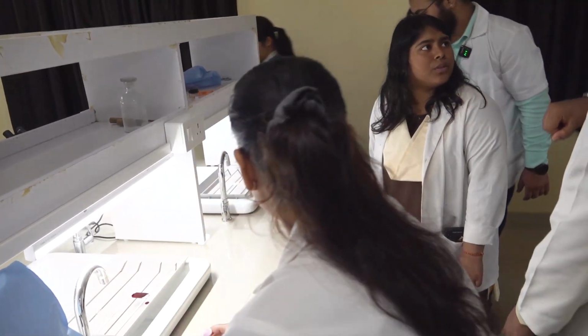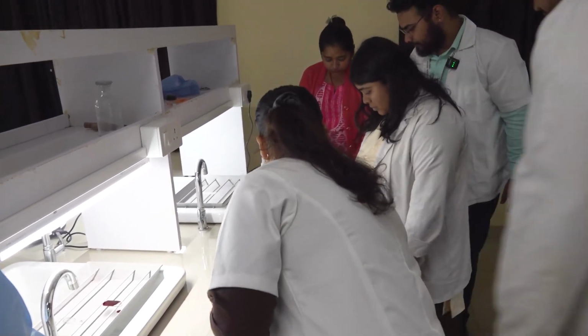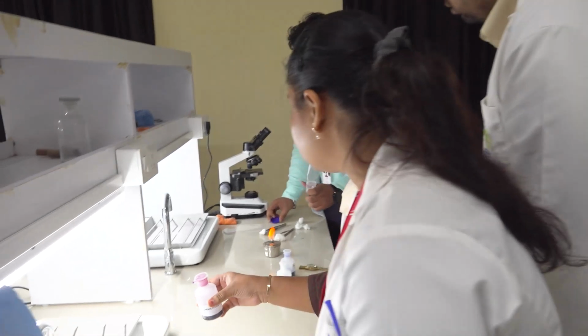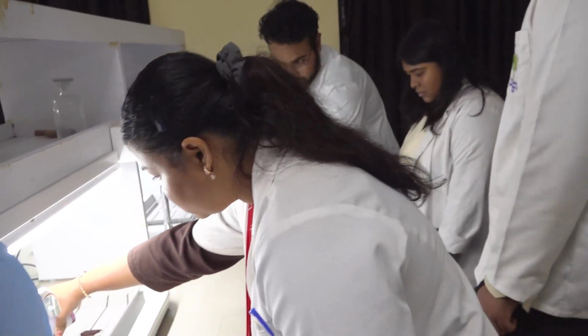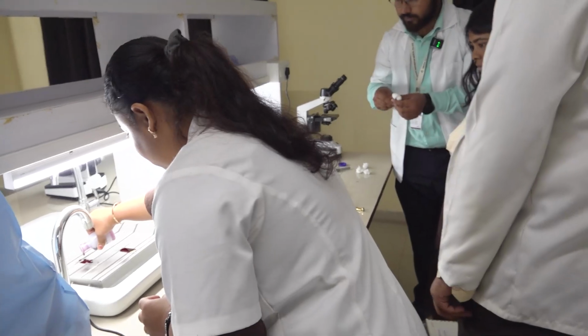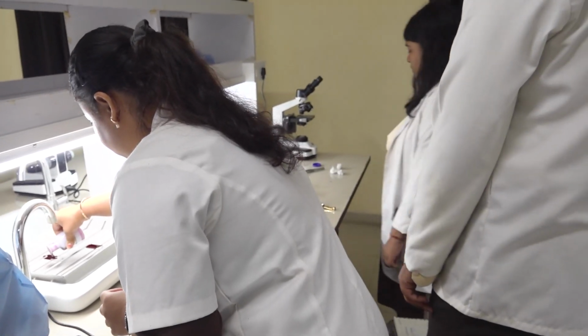Scalpel साथ नहीं यार. आदिल ले. This is alcohol. Okay, I'll show you once and you can do the other ones. Ma'am, please start.